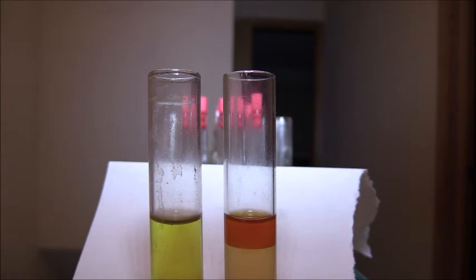And if you hold it up close to a light with the light shining down on the test tube, you can see that this layer has a slight reddish color which isn't really that visible here.